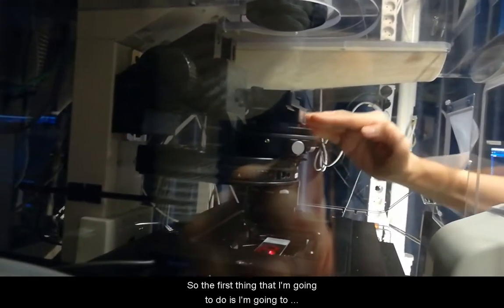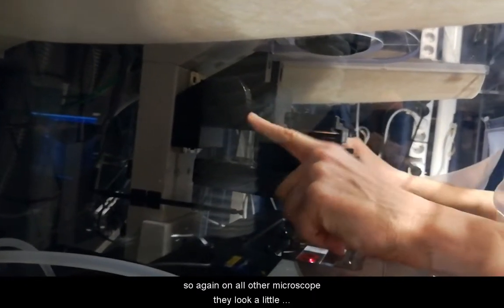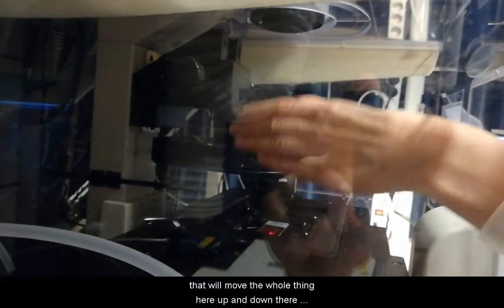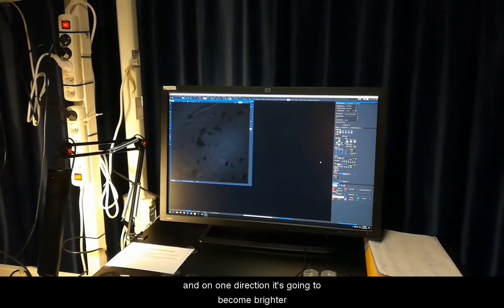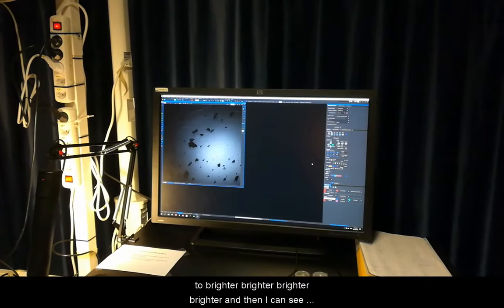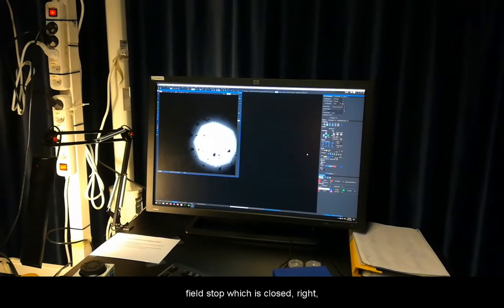The first thing I'm going to do is move the condenser in Z. For this I'm using these big black knobs. On all other microscopes they look a little bit different, but you always have knobs that will move the whole condenser up and down. When I move this, you will see on the screen that I move the condenser up and down, and in one direction it's going to become brighter — that's where I want to go. So I'm going in that direction, and if I bring the condenser down, I go brighter, brighter, brighter, and I can see a spot coming. This is the shadow of the field stop, which is closed.